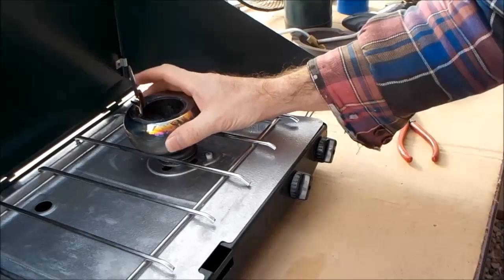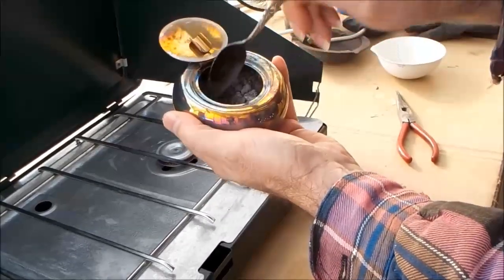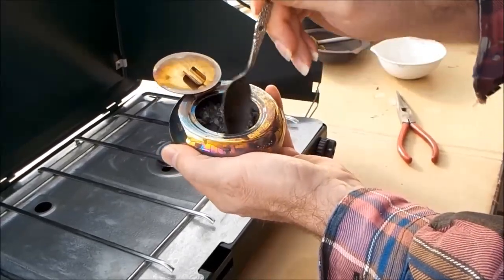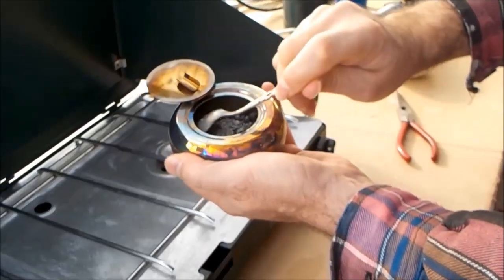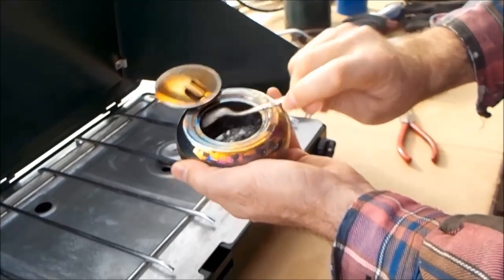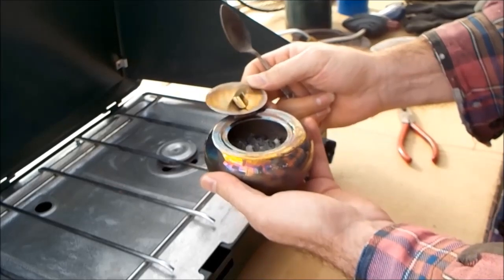Everything's cooled down now. It looks just like ash-gray — interesting, since it came from ashes, now it looks like ashes again. However, I'm betting it's not the same. I'm betting it's mostly soluble, hopefully with the impurities turned to carbon so they can just be filtered out. Back to the lab — I'll weigh what I got and then see if I can put it into solution and see what I can get out of it.